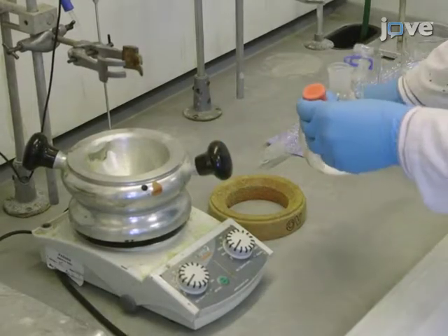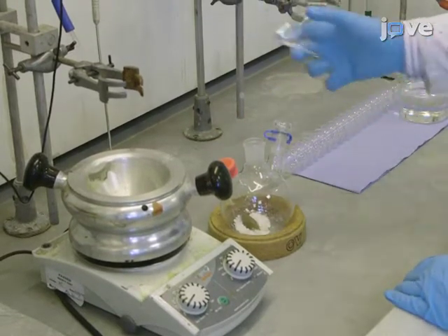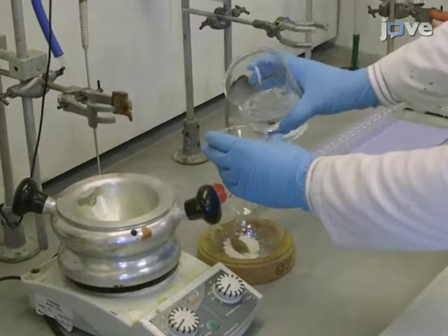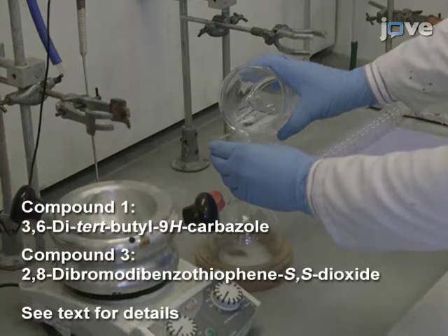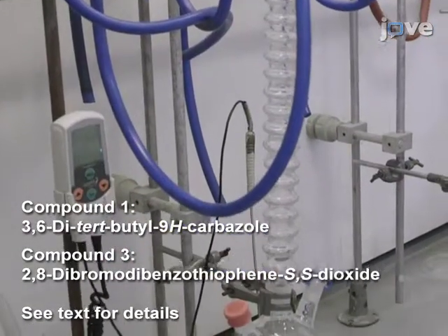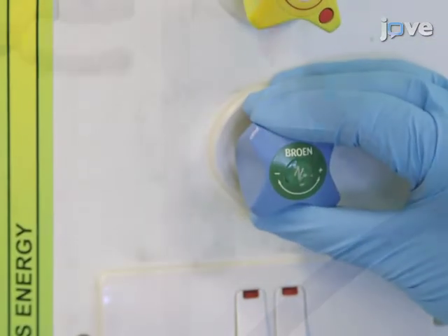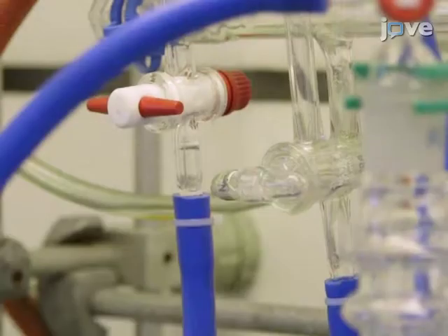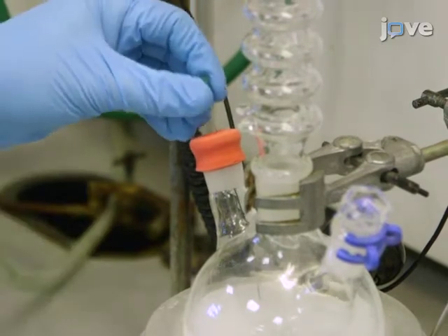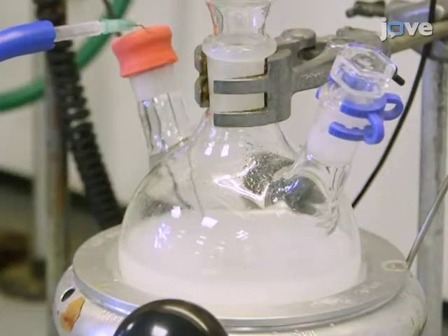To begin the synthesis of compound 4, in a 3-neck round-bottom flask, dissolve 0.80 grams of compound 1 and 0.45 grams of compound 3 in 250 milliliters of anhydrous toluene. Open a nitrogen source and connect to the reaction flask. Then, open up the nitrogen valve and place a needle into the solution. Degas the mixture by bubbling nitrogen gas through the mixture for 15 minutes while stirring vigorously.